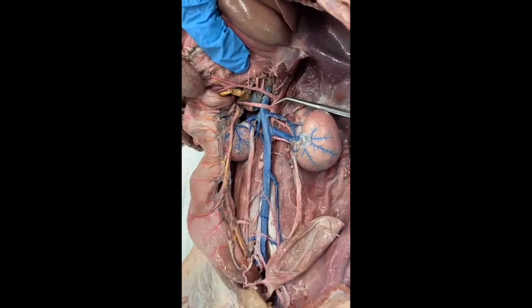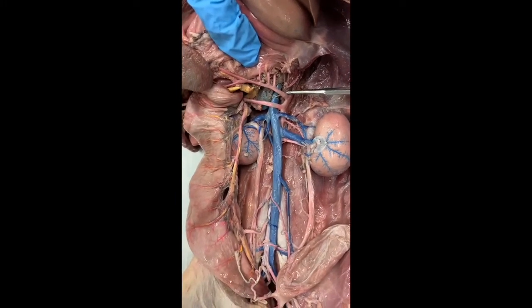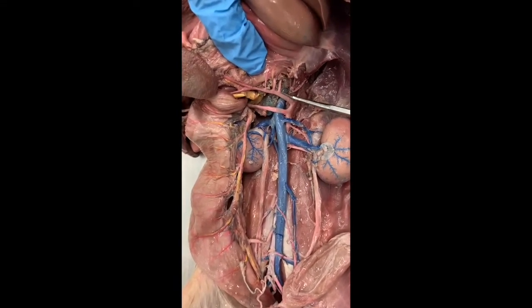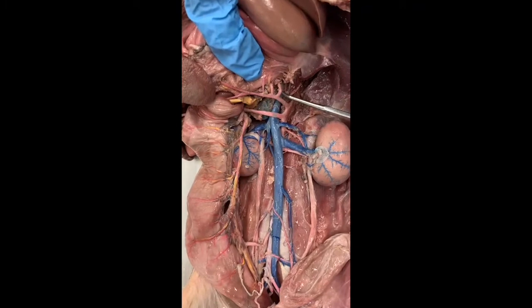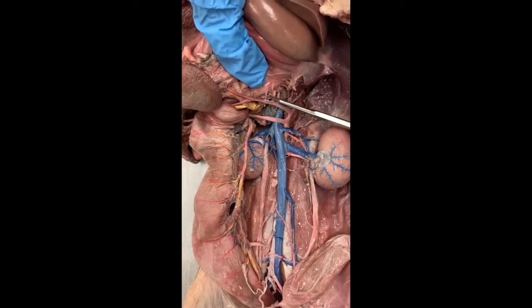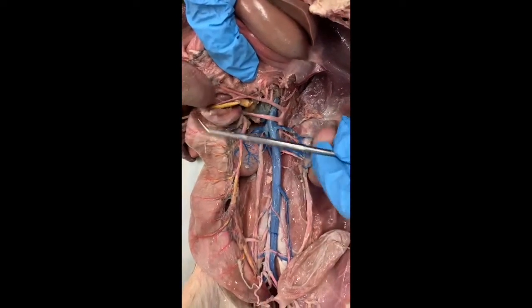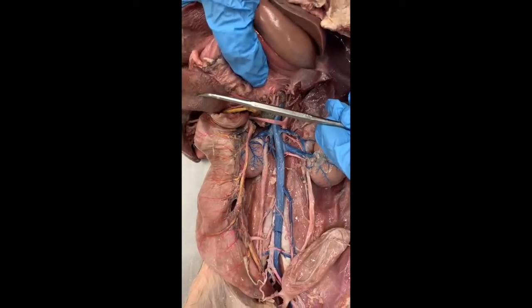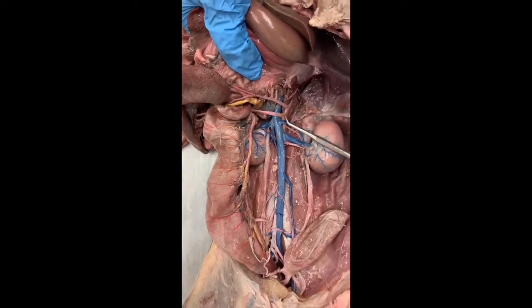Here's the abdominal aorta. The first unpaired branch is the celiac trunk, which has many branches in the human. In the cat there are similar branches, but we're only going to show three of them. This is the hepatic artery. This is one of the gastric arteries, and this is probably another small gastric artery — this one with a Y-shaped form. This is the splenic artery going to the spleen. So here's the spleen. All of these are coming from the celiac trunk.